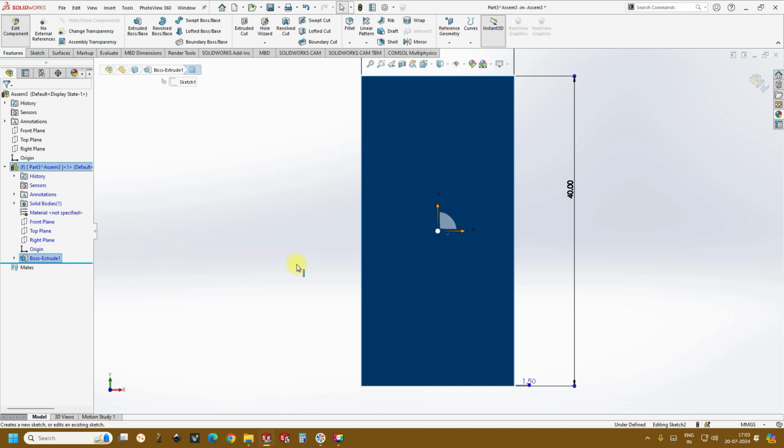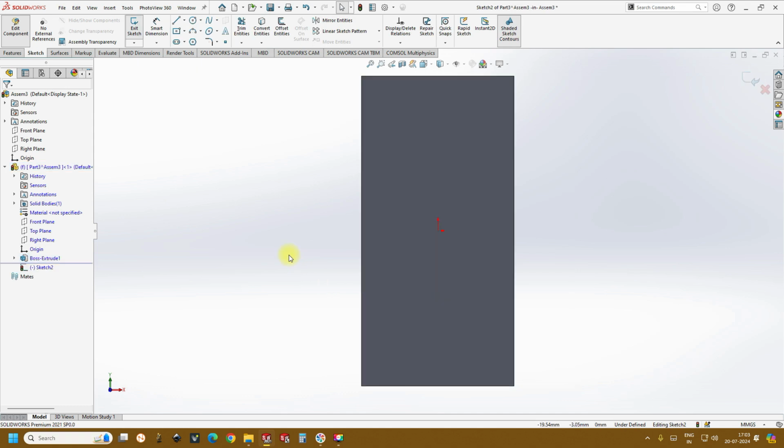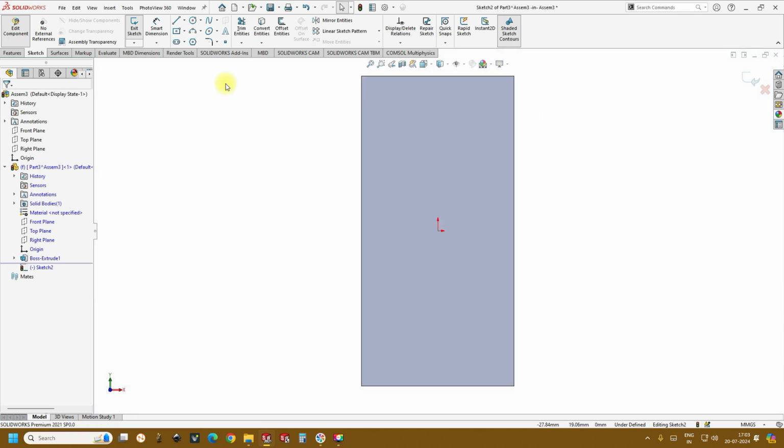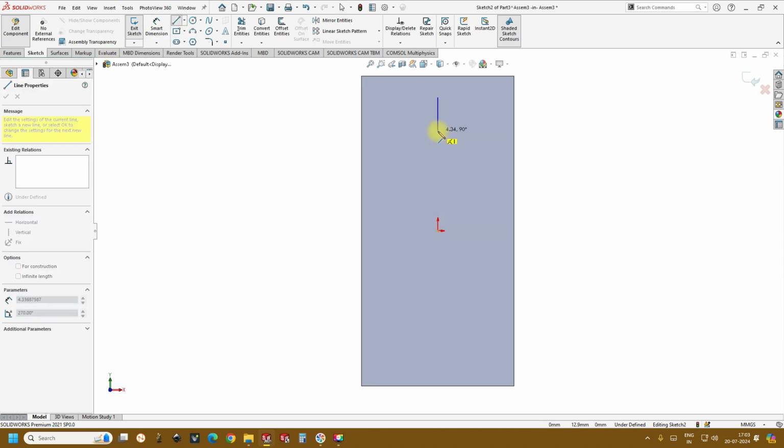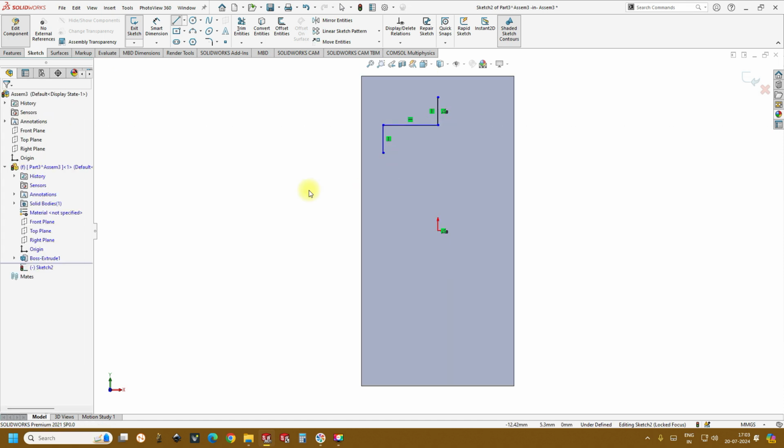Click on this. So this is the crucial, important space where you have to concentrate. So now, just changing the background to white, take a line. Okay, so now I'll show you the easiest way to make these zigzag channels, or not only zigzag, even the serpentine channels.